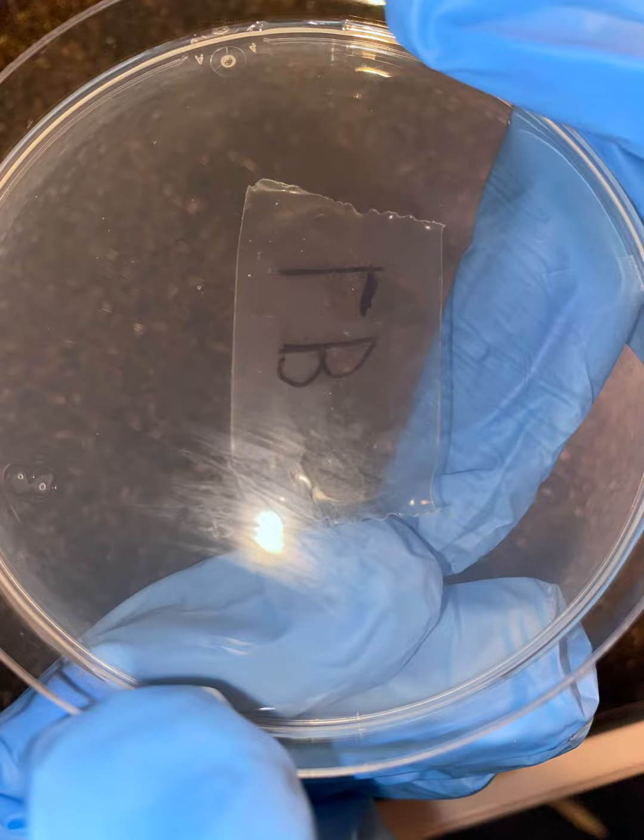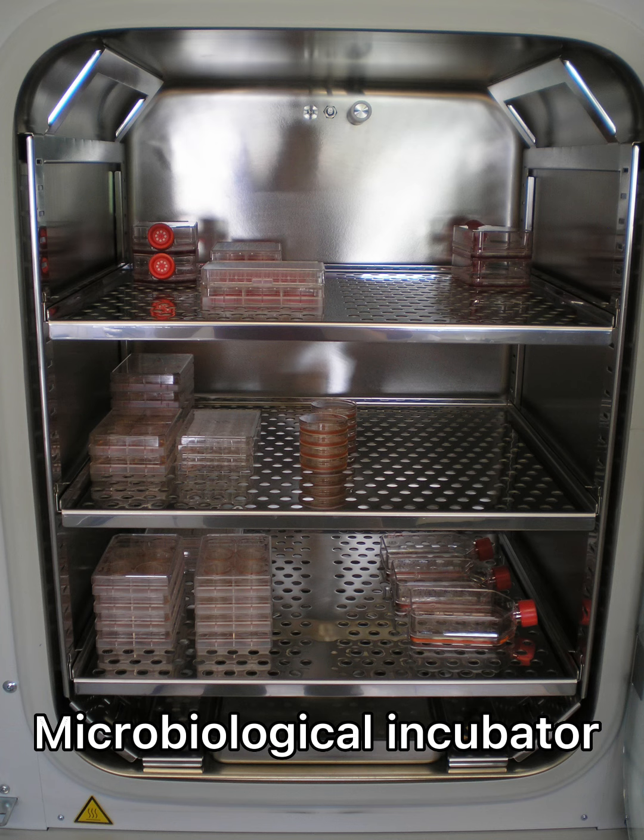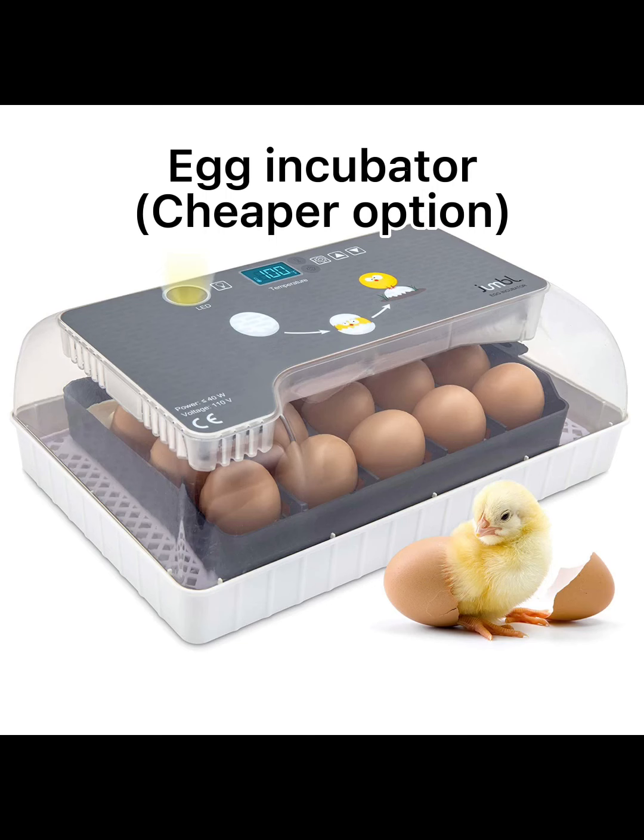This next step will require waiting for a few days, but it is very important. You'll need to incubate your E. coli for them to grow properly. This can either be done at room temperature or at temperatures up to 37 degrees Celsius. Growing your E. coli at room temperature will cause them to grow slower, but it will still work.